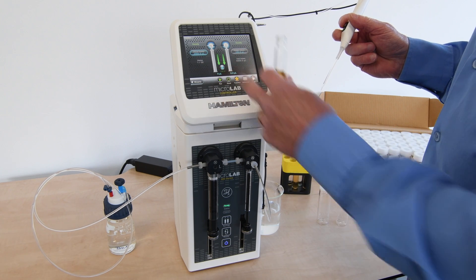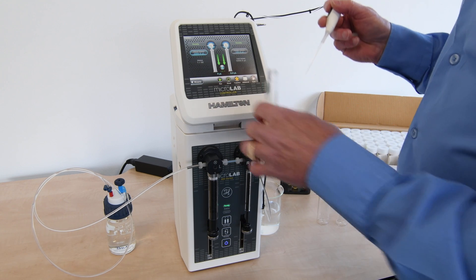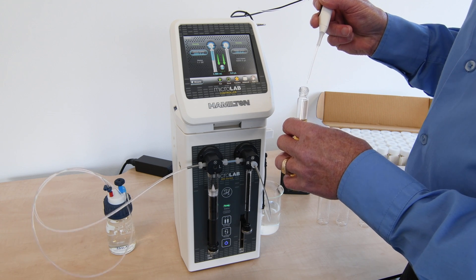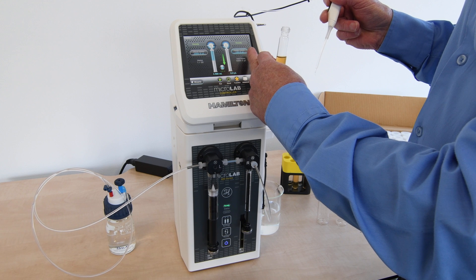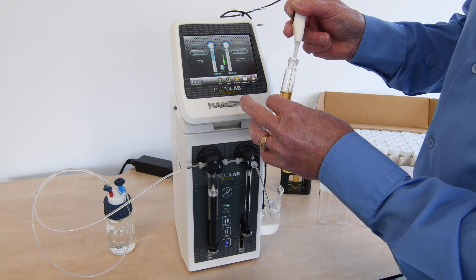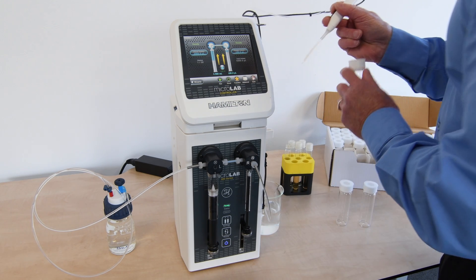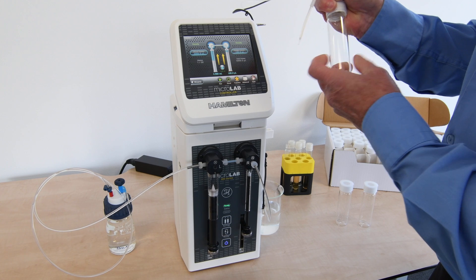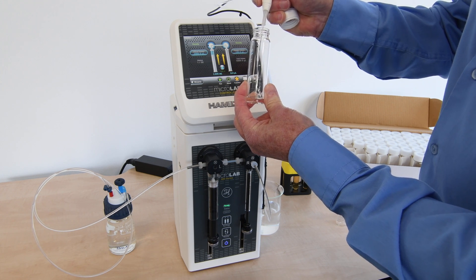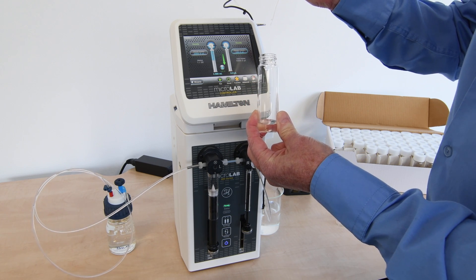You can see illuminated with the blue light that it's going to aspirate the volumes here, showing the 4,900 microliters of diluent as the first step. The next step is to take the sample, which is illuminated blue, and we can aspirate that. Press the button and now we've dispensed both the diluent and the sample, giving us a 1 in 50 dilution.